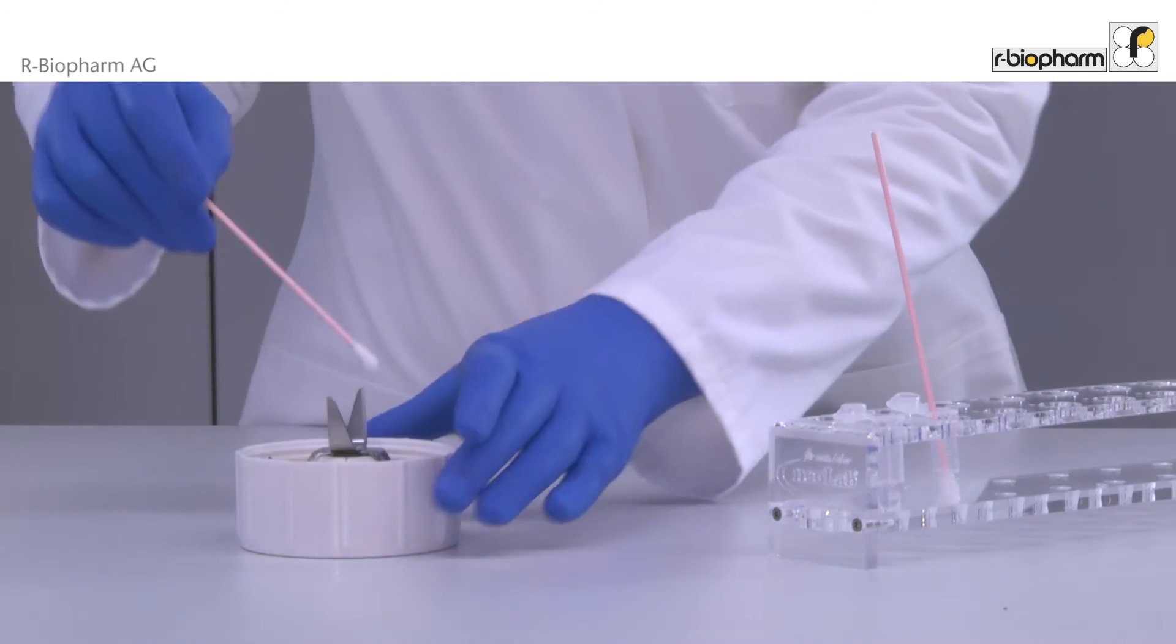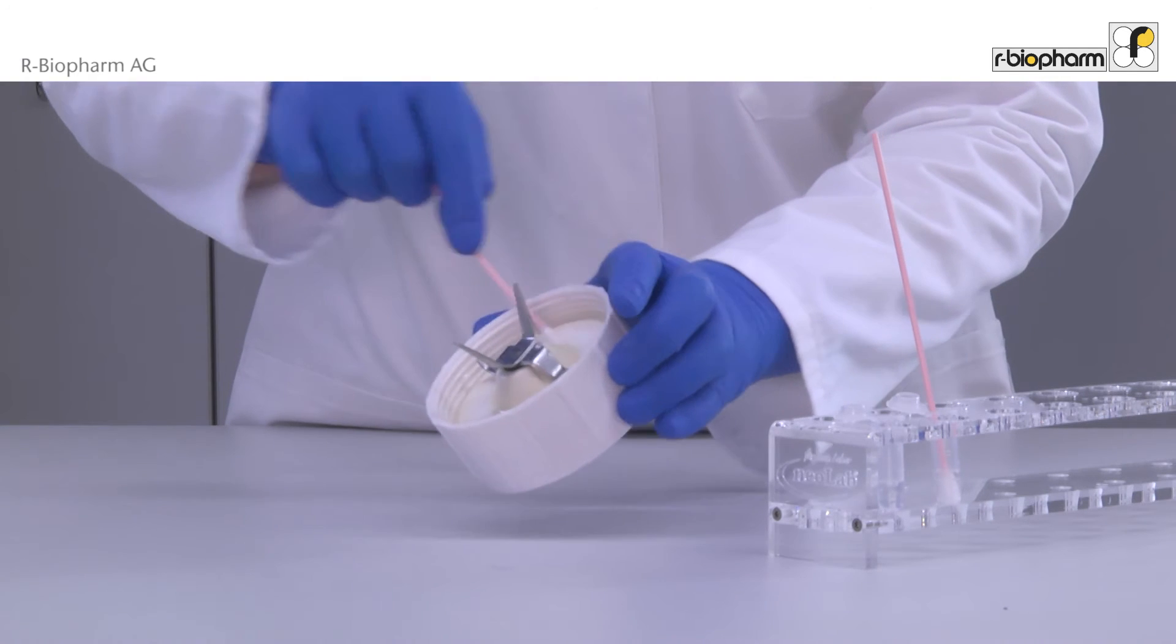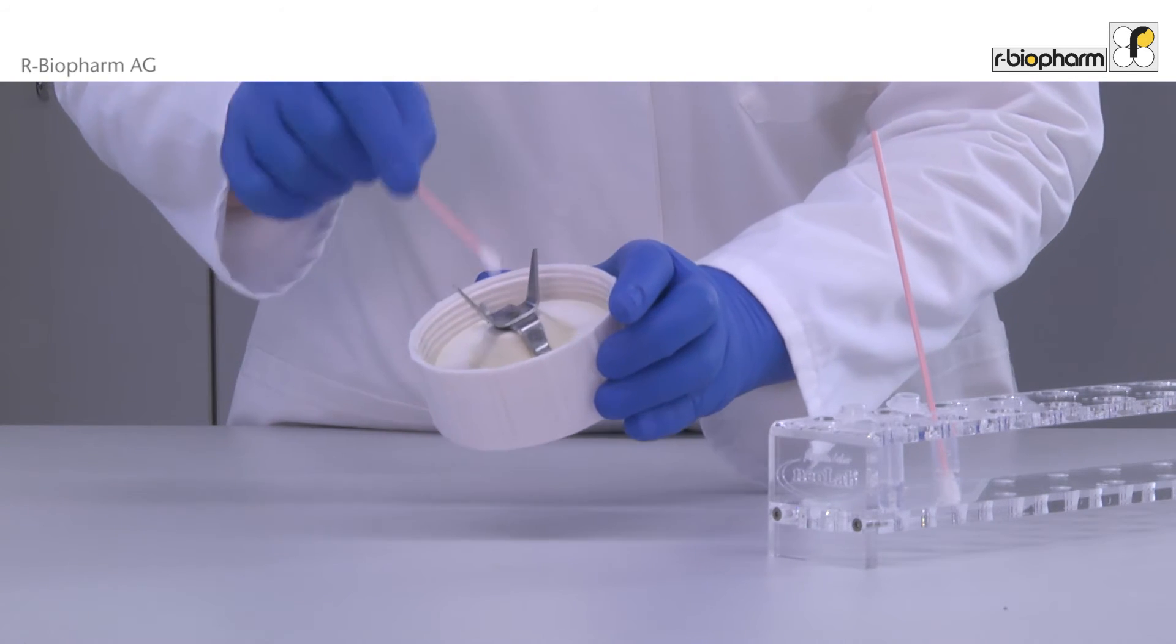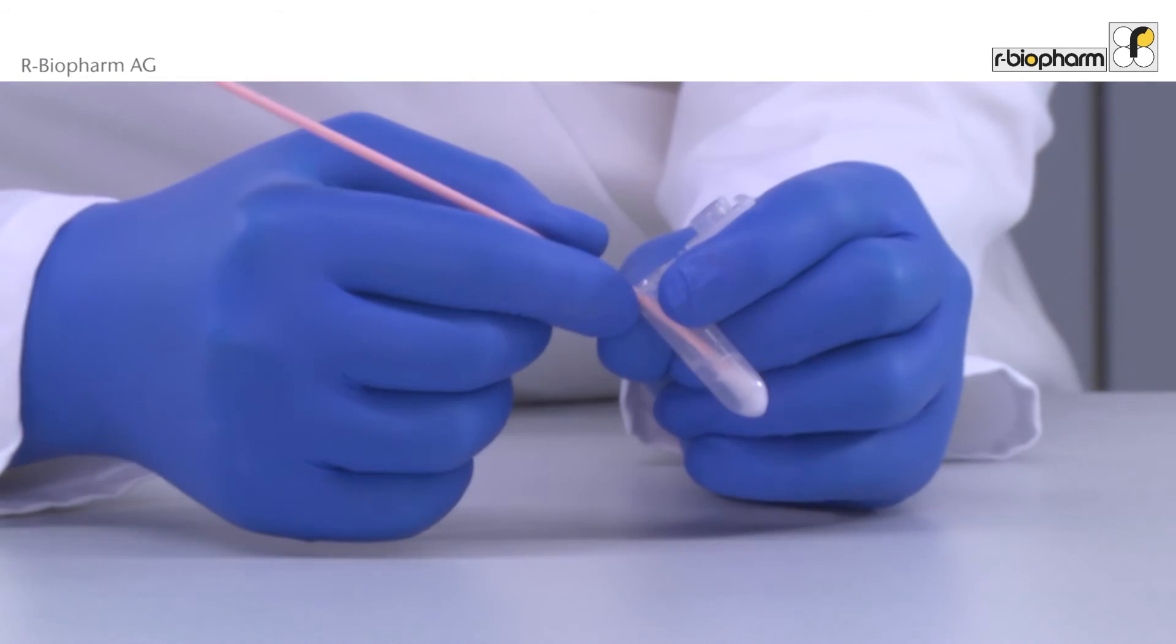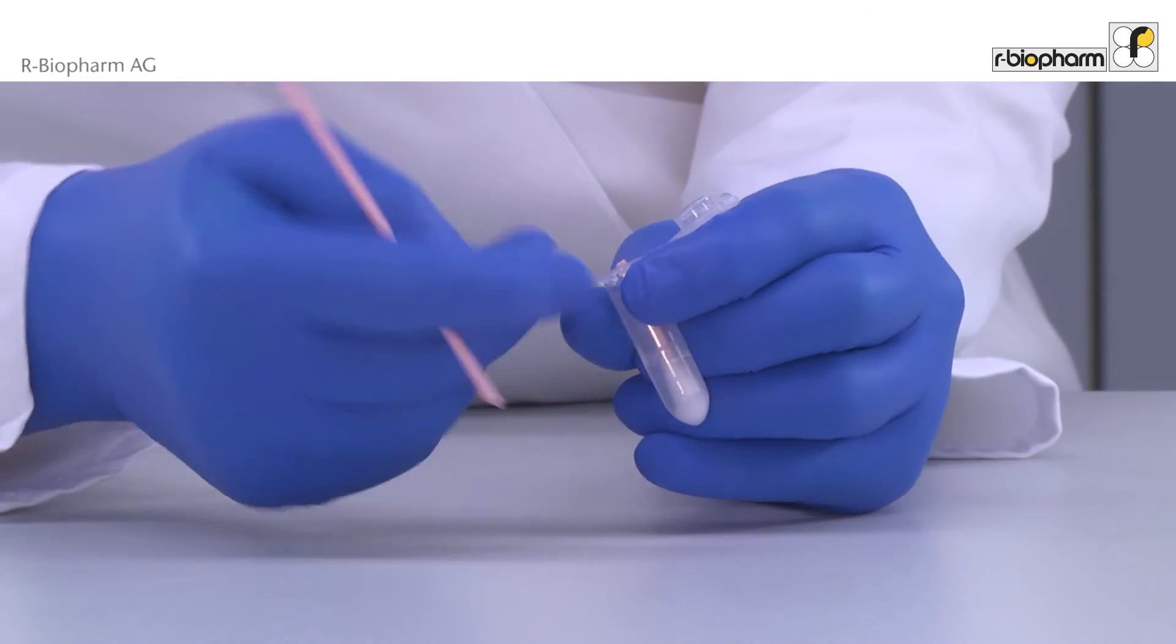A second swab is taken from the inside of a blender. Next, the upper end of the stick is broken.